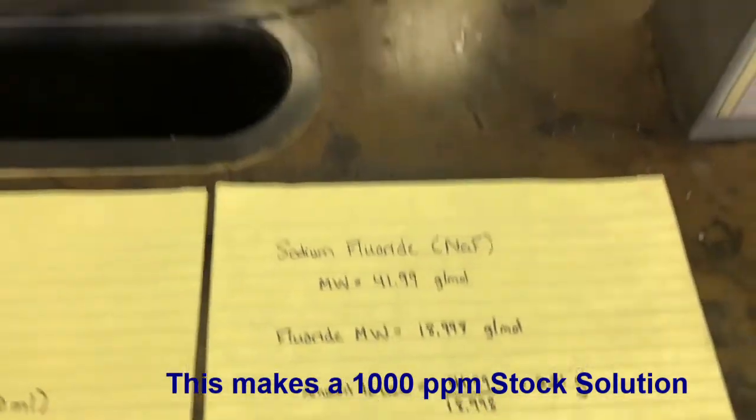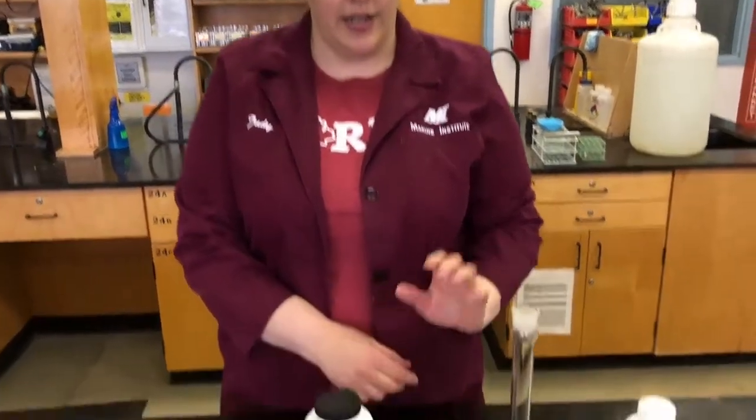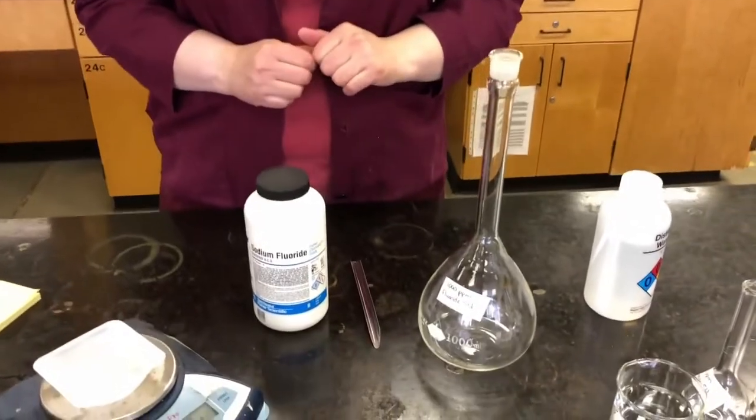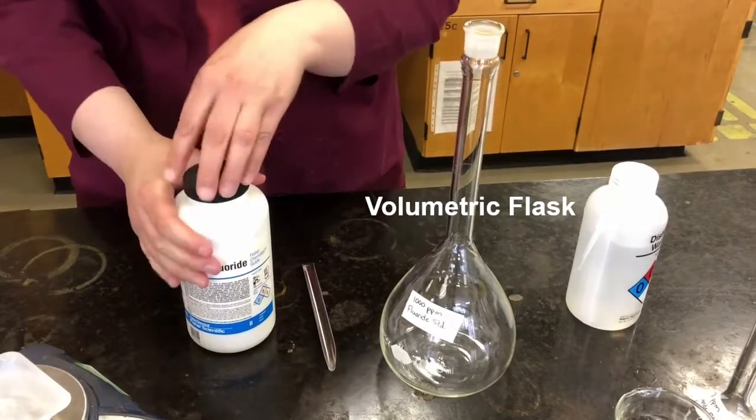So we take 2.21 grams, we measure that out using a scale. You want to have at least 2 decimal places on your scale. And then we dilute that down to 1 liter in a volumetric flask. So this is a volumetric flask. If we measure out our water up to the line, that's exactly 1 liter. So I'll show you how to do that in a second.